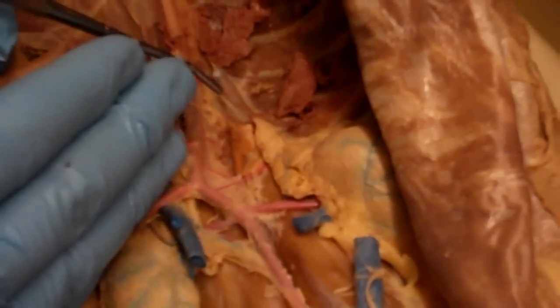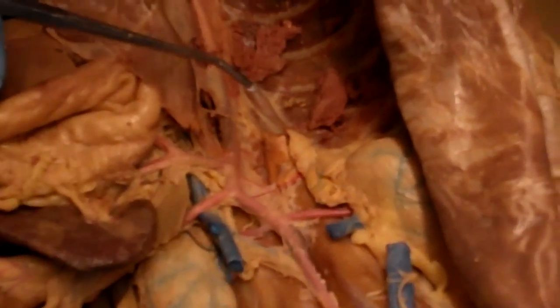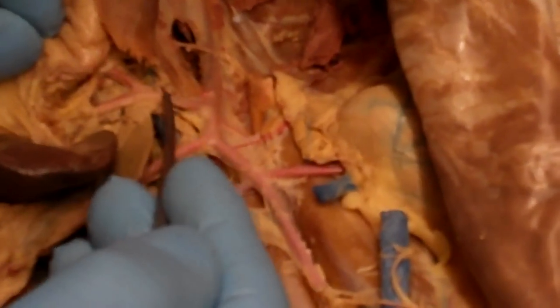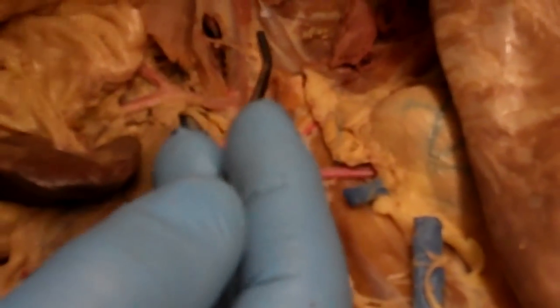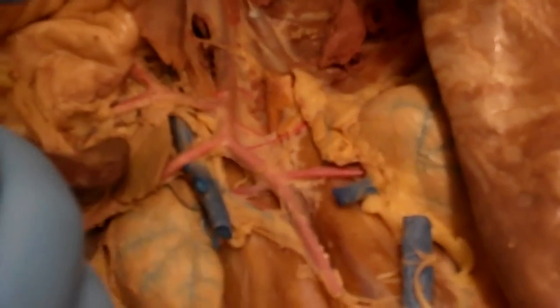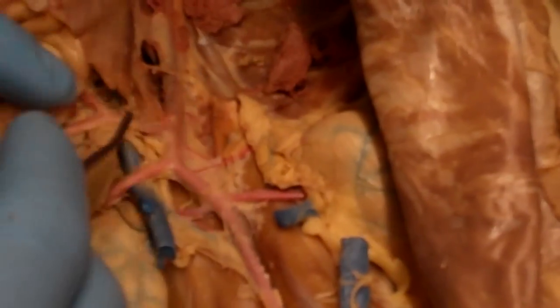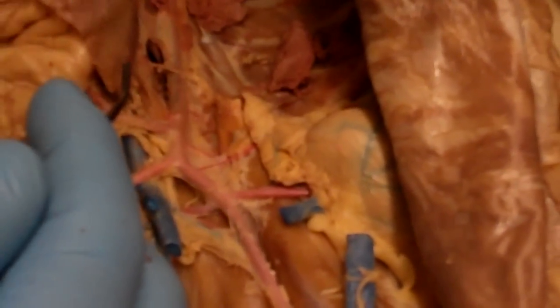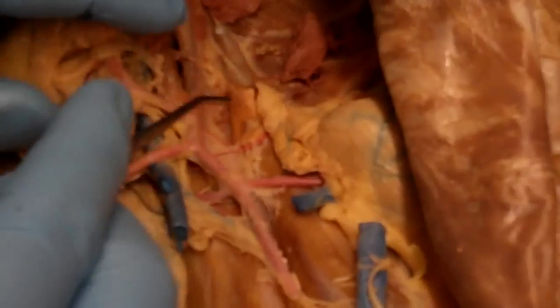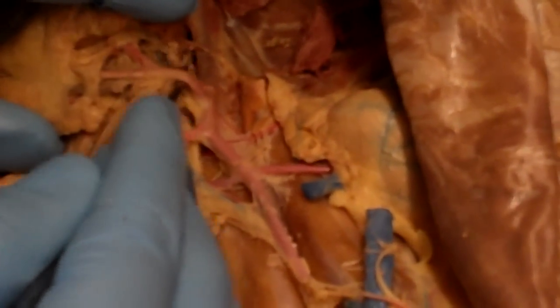The thing that's nice about the arteries is they match sort of the pattern of the GI tract and the organs. So the first branch off of the abdominal aorta is going to be the celiac artery. And it's going to split into three branches that you don't need to dissect out, but it'll branch into a left gastric, a hepatic, and a splenic artery. And they do exactly what they say. The celiac is going to feed the stomach, the liver, and the spleen, which are sort of the most superior organs in the GI tract. So that's going to be the celiac artery. And again, there's only one celiac artery.